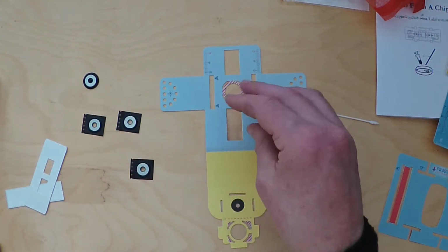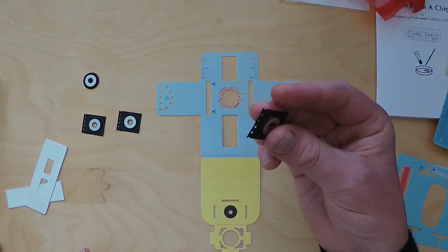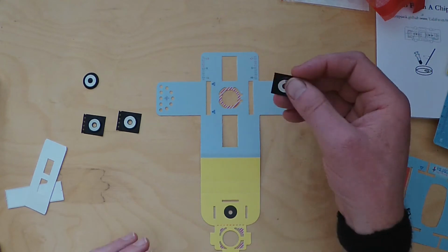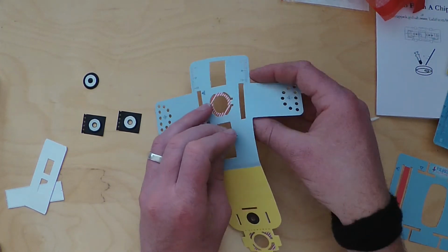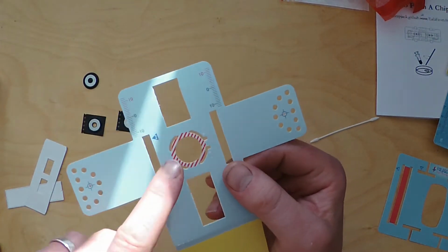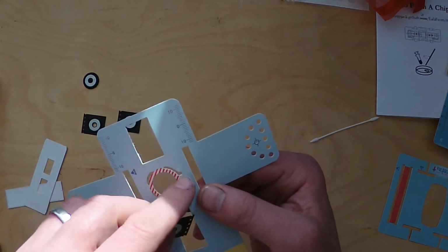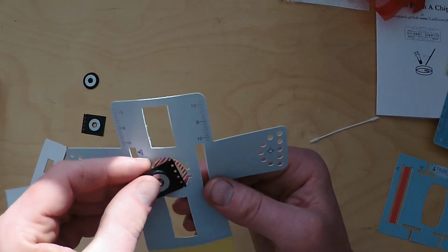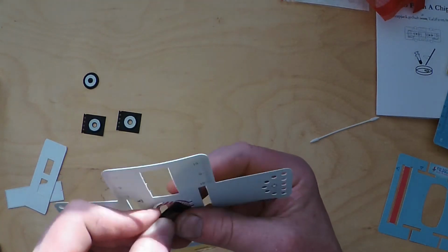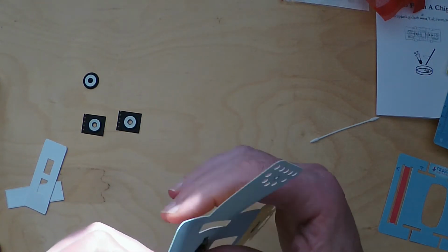So the first step is to place one of the couplers silver side up with the alignment holes, perforated bit here, to the right. So if you look on, make sure your lens stage is this way up with the blue and the yellow at the bottom and the red stripes there. You can see some white perforated images on there, and basically you want to slot that in and just tuck each corner underneath like that, like so. Yep. And then pop. The other ones are a little bit more tricky.